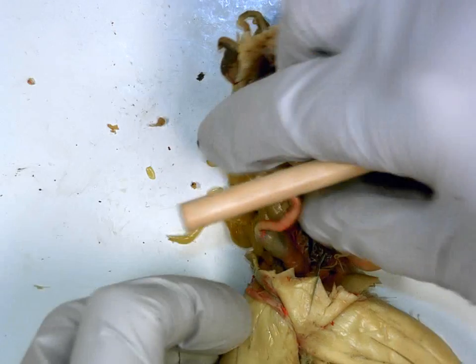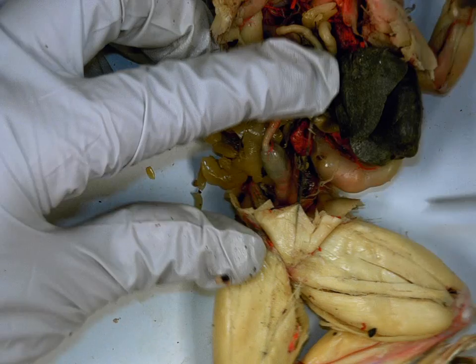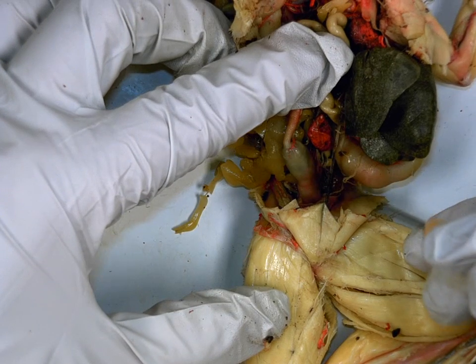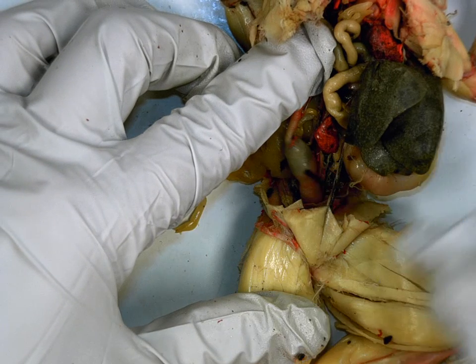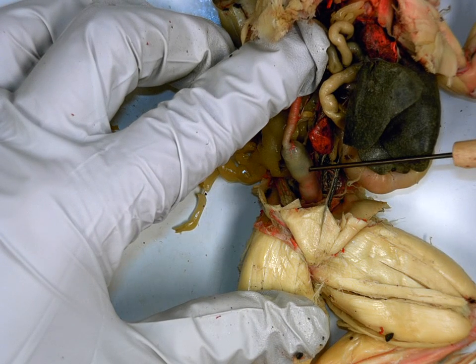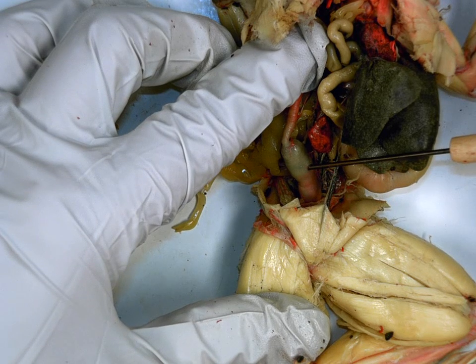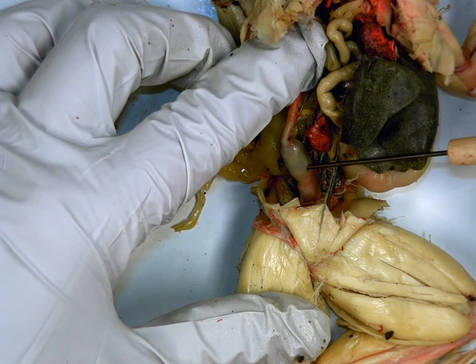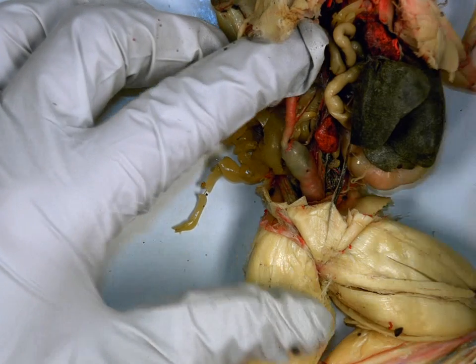Now, if you follow the skinny tube of your frog, you should see it come to what looks like a short, thicker tube at the very end. What is this? Large intestine. What is its function? Pack the feces and absorb water. So it removes the water from the feces and packs it. Okay? And that was the entire digestive tract.